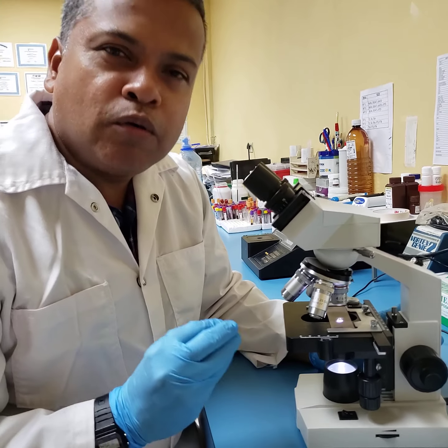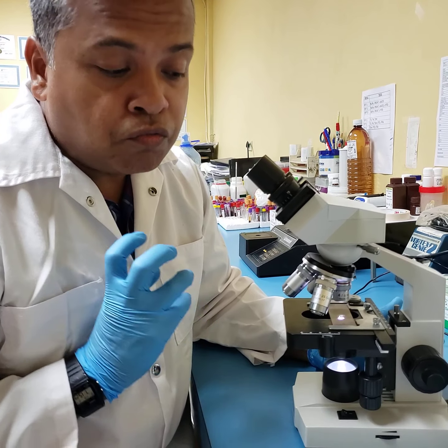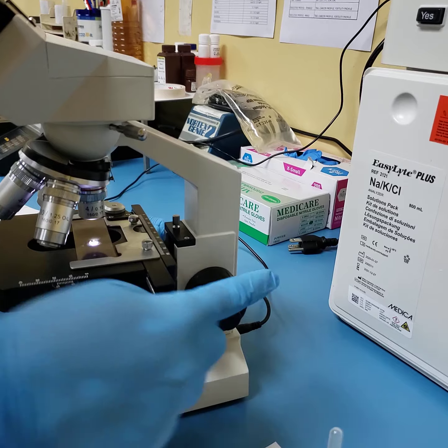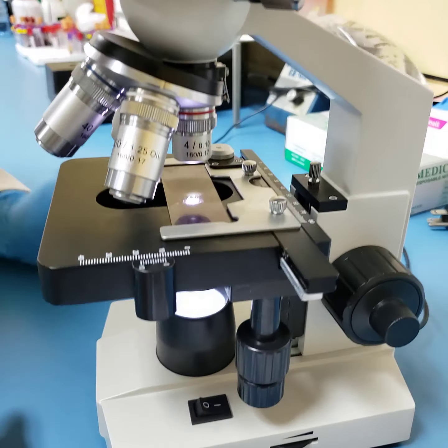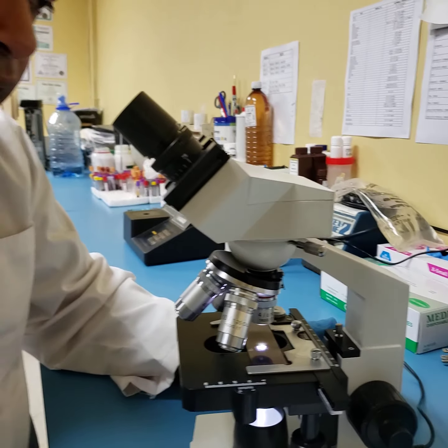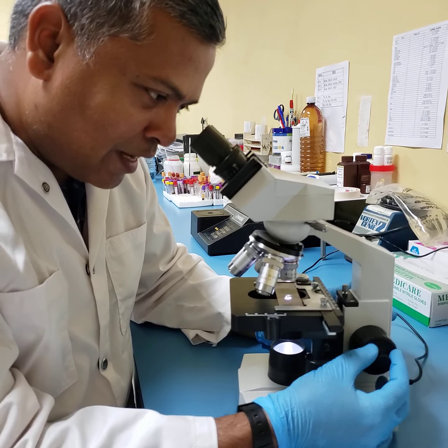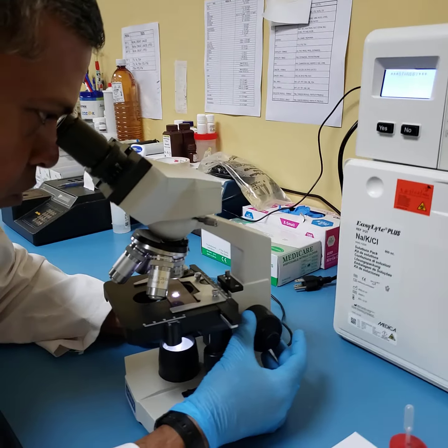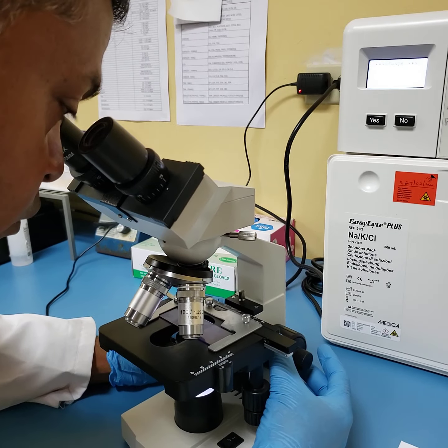The next step I'm about to share with you is very important. Before I do that, I just want to reiterate to you guys, the coarse adjustment knob has been turned straight up and the lowest lens has been adjusted and is facing down. At this point, and only at this point, students and microscopists, you look at your image, because your eyepieces have been adjusted to suit your eyes and we are seeing one zone of illumination.